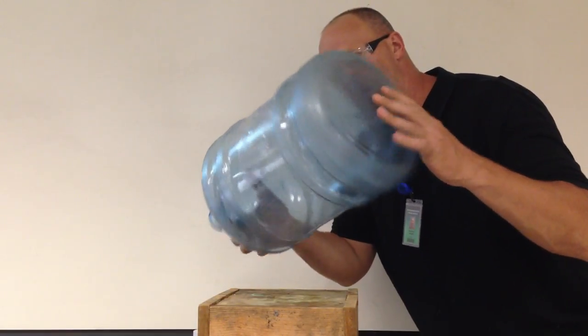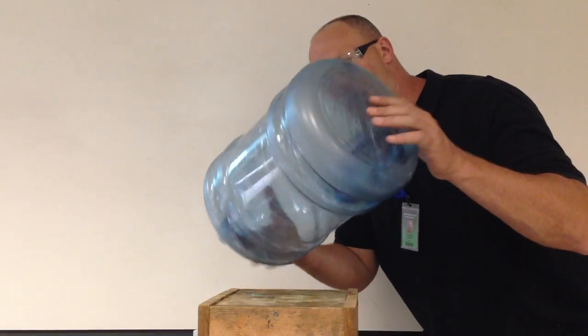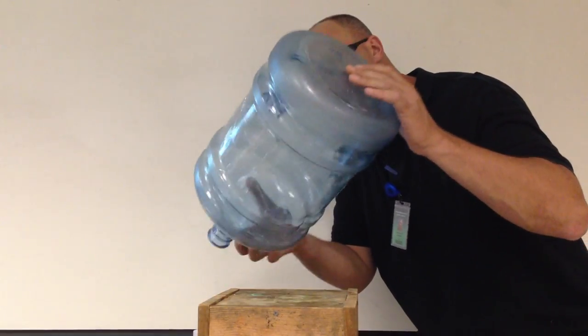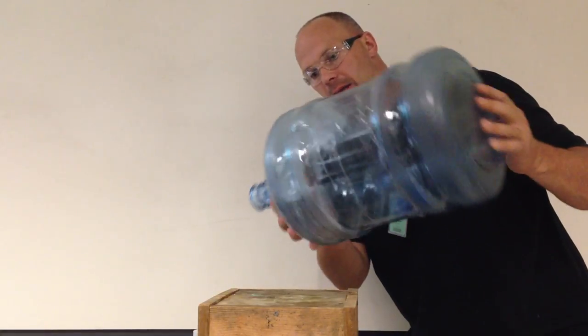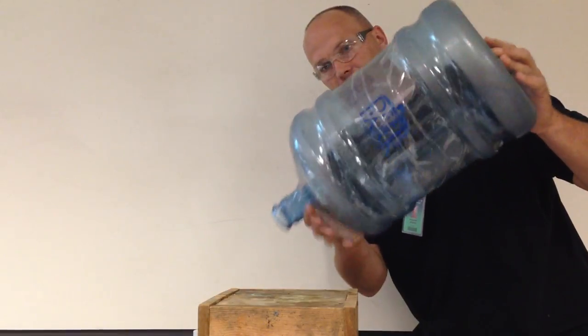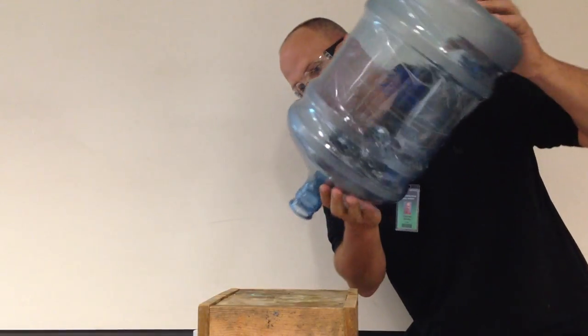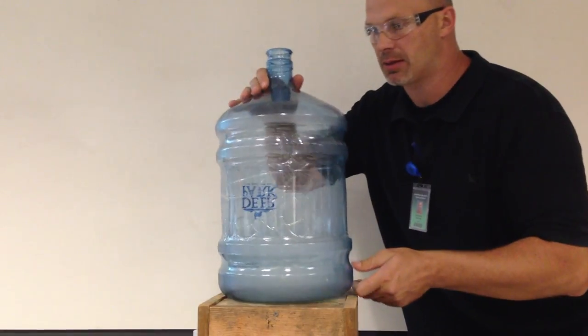So I'm going to turn and I'd like to talk about evaporation as a cooling process at this point. And I have students feel the end of this and it feels cold. And if you can see, all the alcohol that I've added is now a vapor. I've increased the surface area. As you can see, I shouldn't have much emptying out. More is not better in this case.